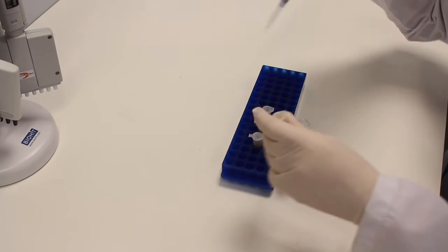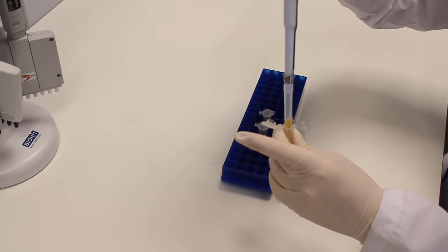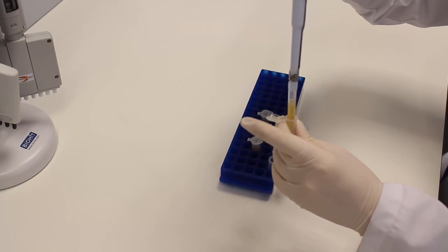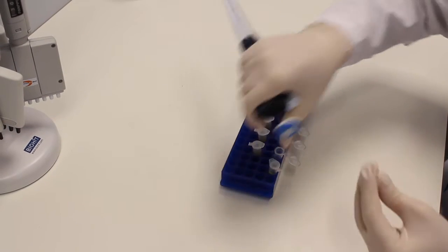After each step transfer the supernatant into a new tube. Then discard the pellet.